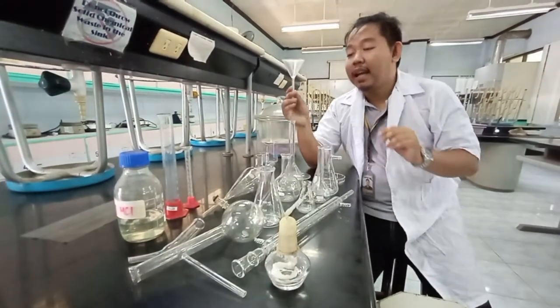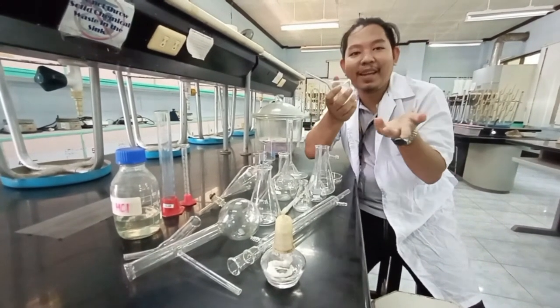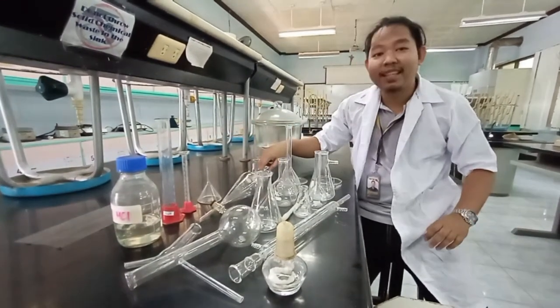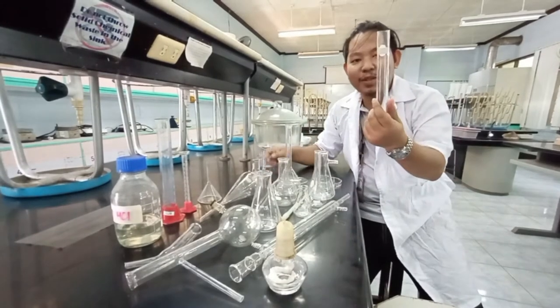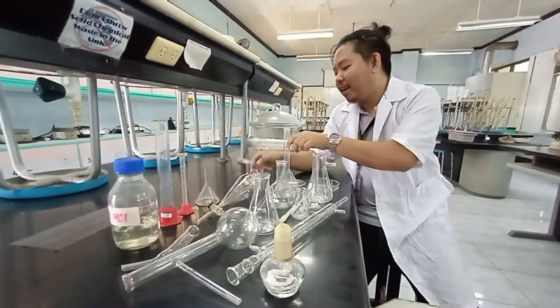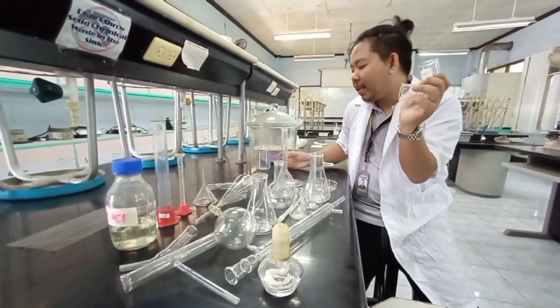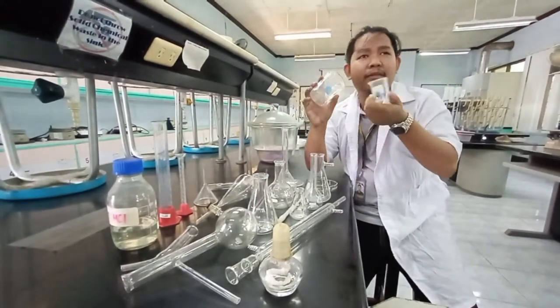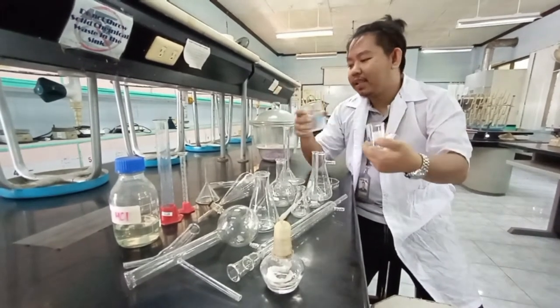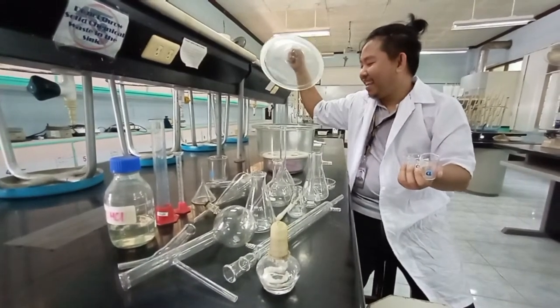And then we have the glass funnel — like a regular funnel but made of glass, to avoid contamination. Don't use plastic. We also have test tubes in different sizes. And finally, we have our beakers — the small ones and the big ones — in 50 ml, 100 ml, and 500 ml. So these are your glasswares.